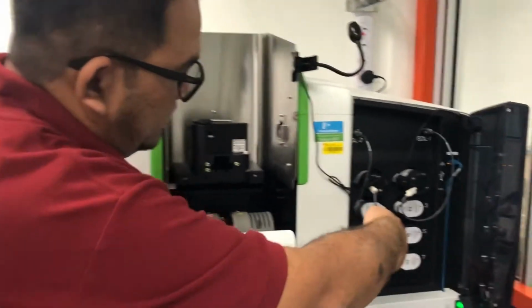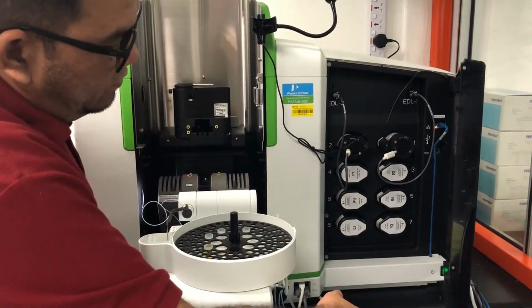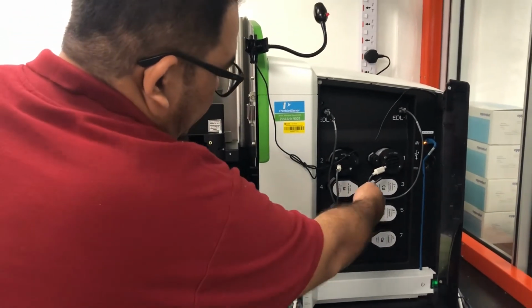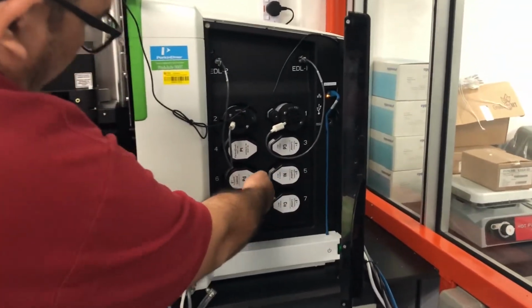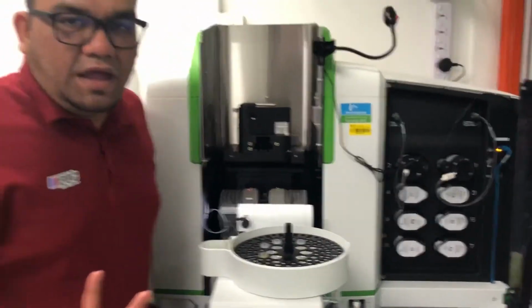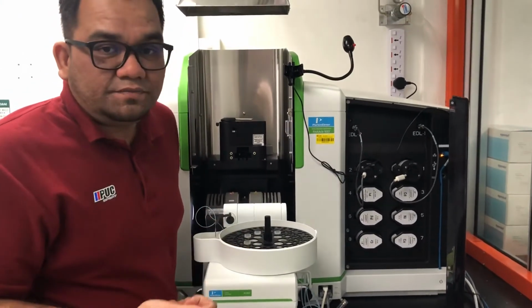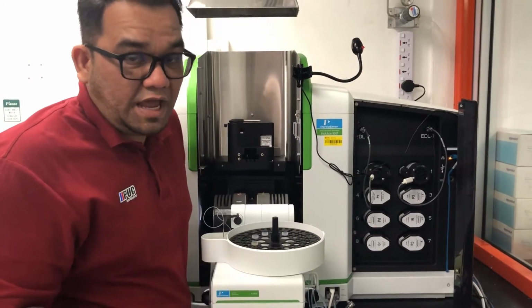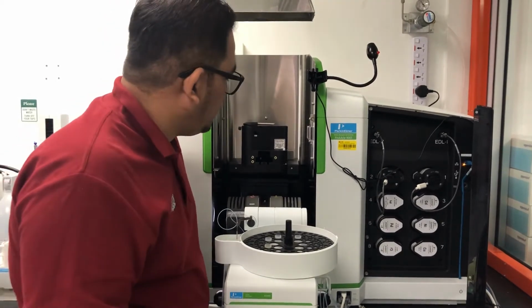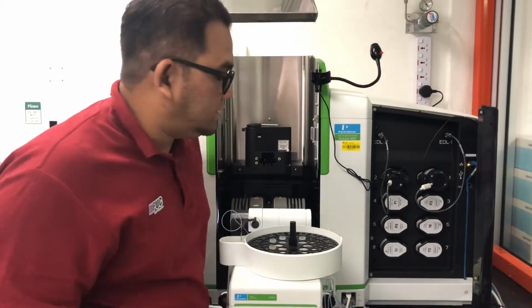This is the source of the spectrum. Okay, as I told you, we have a different type of lamp for different elements. We have cadmium, nickel, copper, chromium, palladium, platinum, and so on. We have a lot of elements source of spectrum. We have EDL or HCL. Okay, either EDL or HCL type of light source, different for different elements, right?